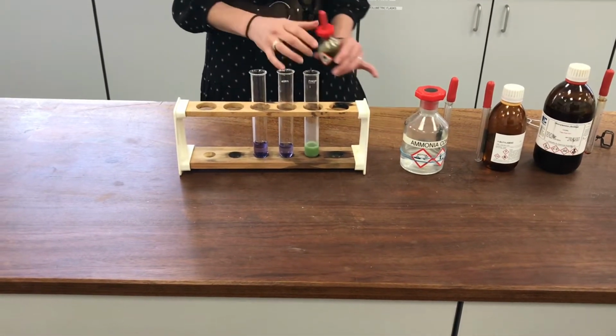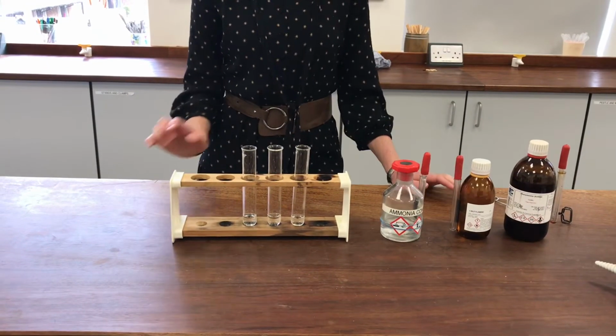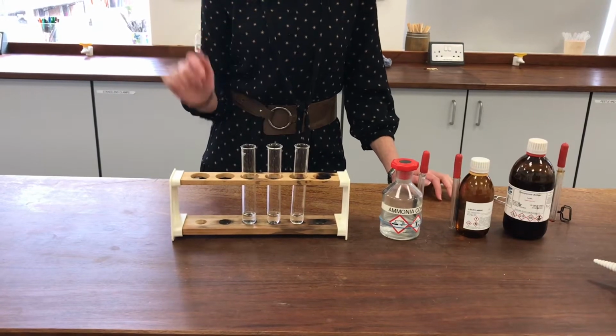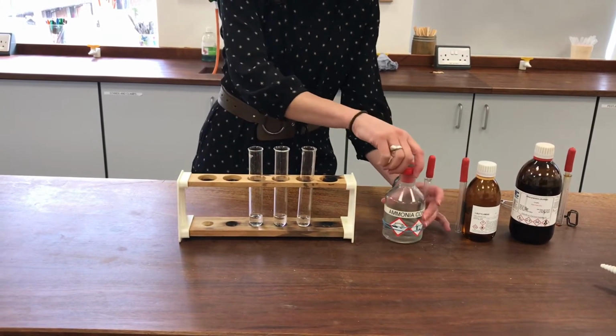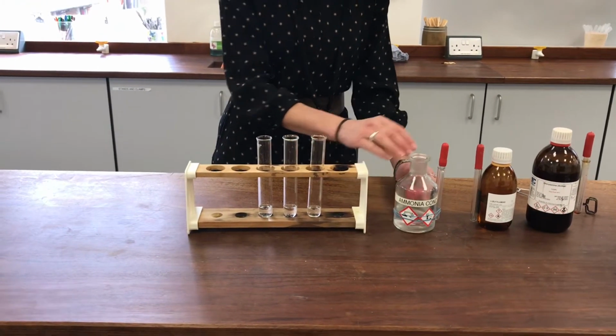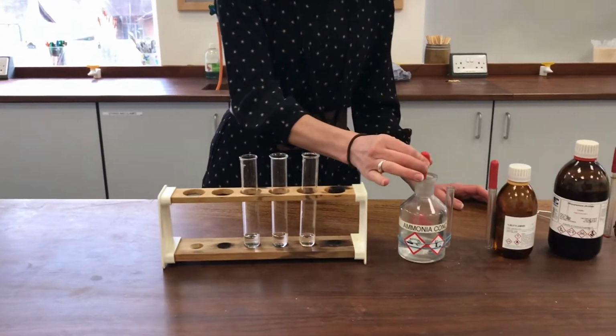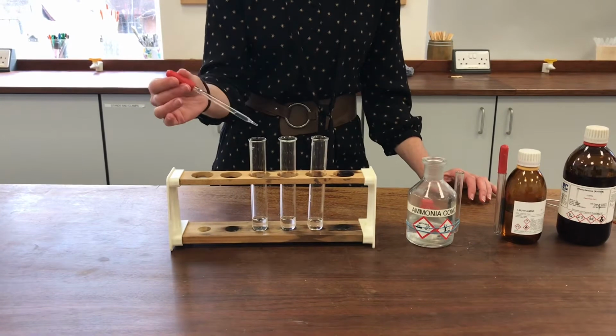Okay, second experiment now, and this is to try dissolving these amines into hydrochloric acid, and I want to see if they're slightly more soluble in the hydrochloric acid than they were in water. Now, we might expect that they should be, because obviously these are basic. We just proved that in our previous little set of experiments. So we're adding a base to an acid, and we're expecting it should obviously make a salt and water.